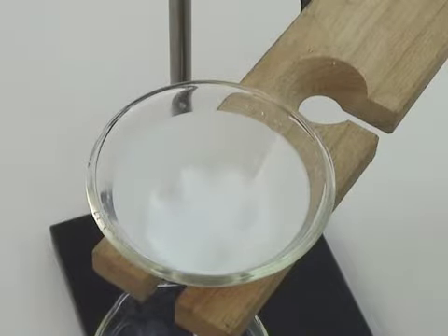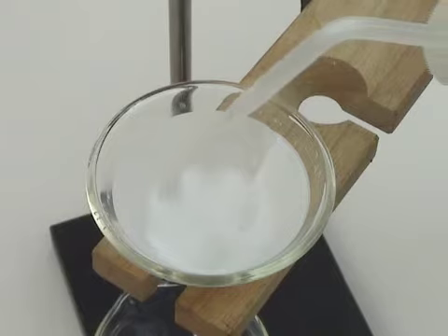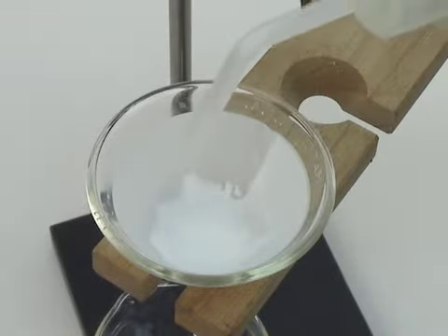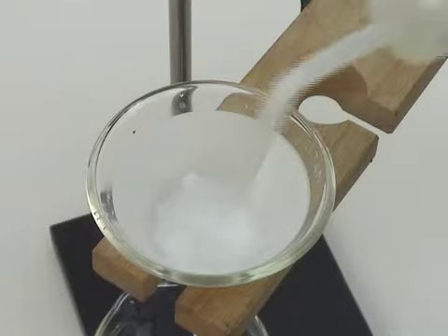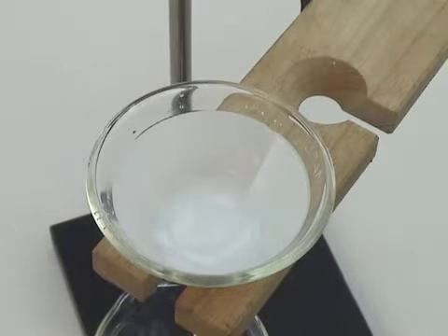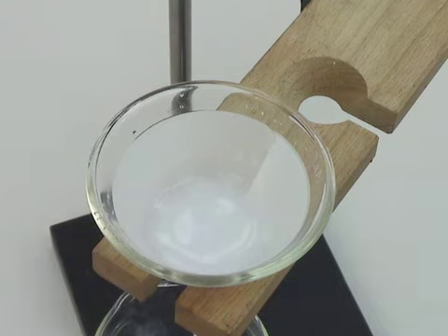When all of the precipitate has been transferred into the filter paper, we'll have to wash it free of any impurities. The first rinse should be used to direct all of the precipitate down into the pointy cone of the funnel. After that, the filter paper should be filled and allowed to drain several times. There's usually some sort of test we can do on the filtrate to make sure that there are no impurities coming through anymore. And that concludes this video on filtering techniques.